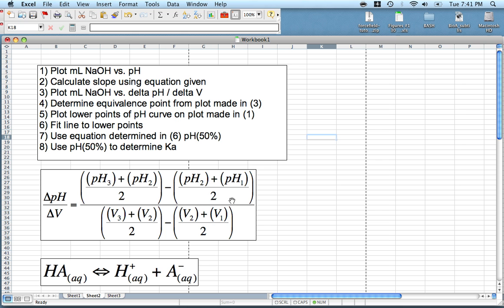So if you see here, I have 3 data points: pH1, pH2, and pH3. This is not just 3 random points. This is in sequence. So the first delta pH delta V value is going to be pH1, pH2, pH3, and then the second delta pH delta V will be pH2, pH3, pH4, etc. Same with the volumes.